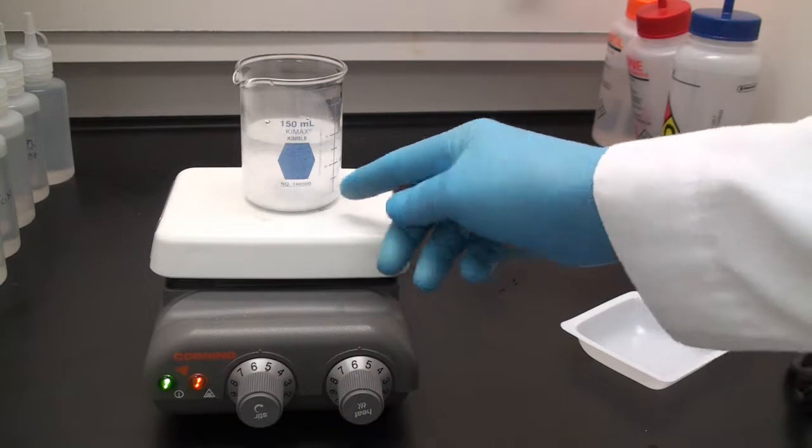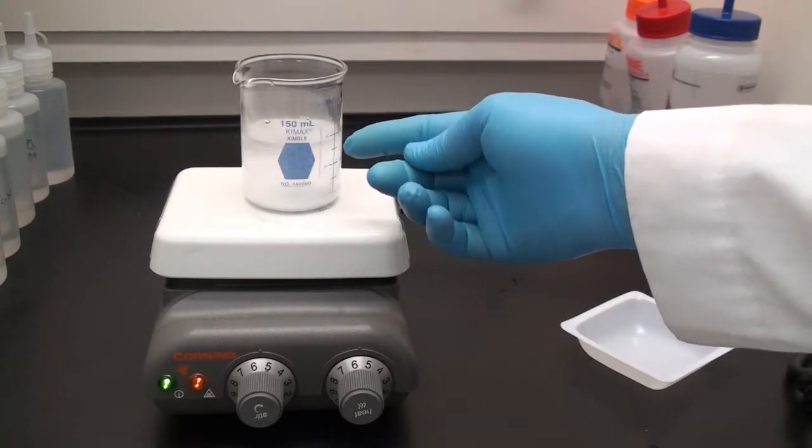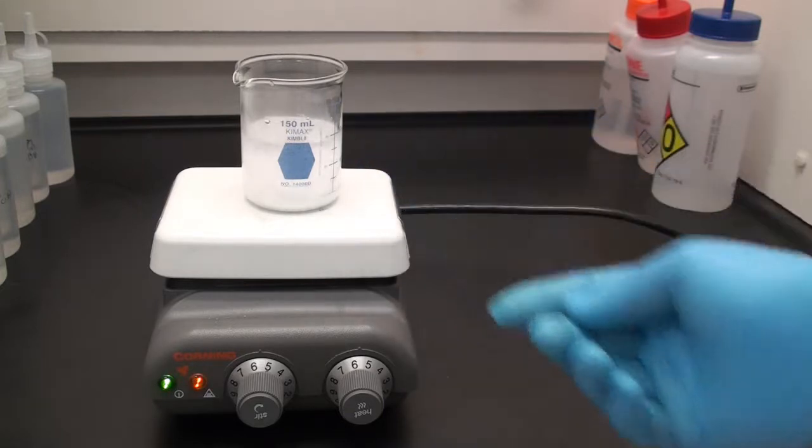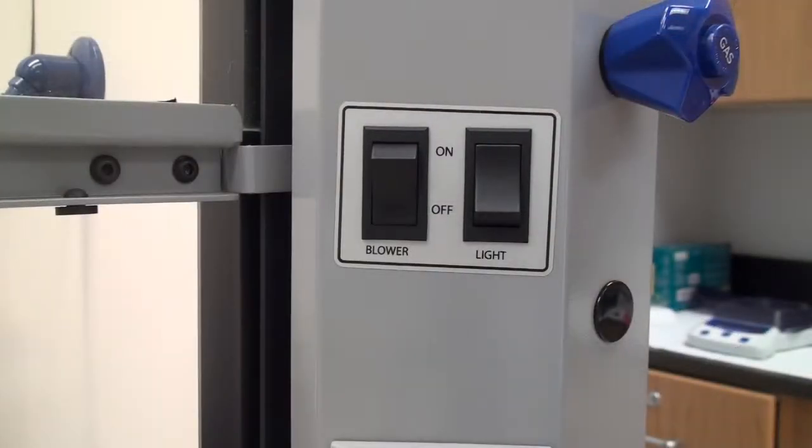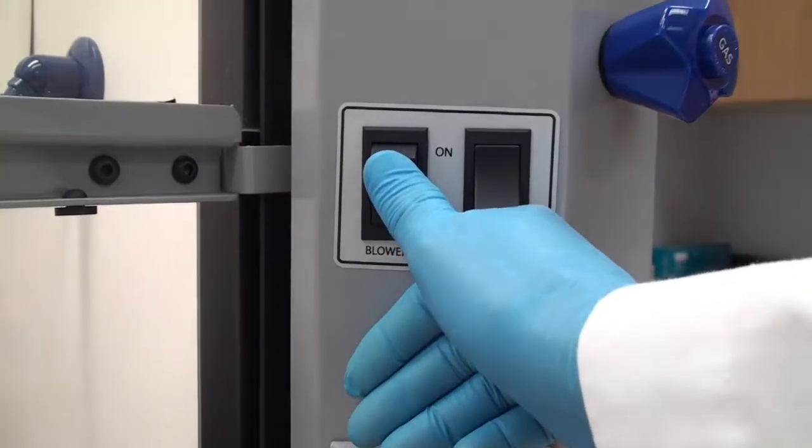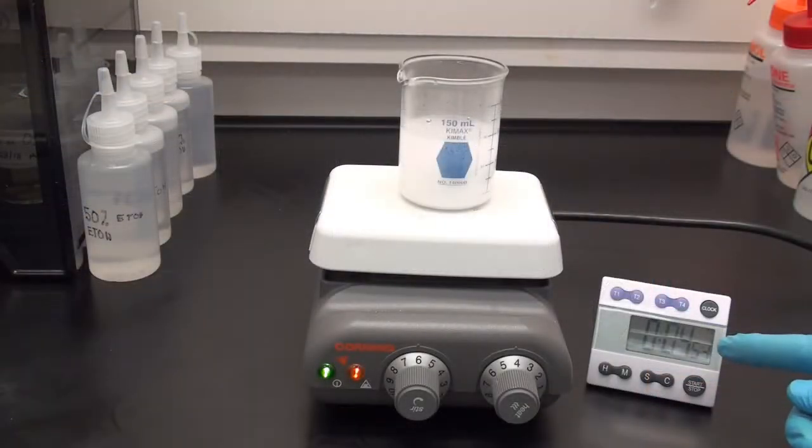Don't over-spin your stir bar, otherwise you can get a vortex that could splash out. Since this is going now, I'm going to go ahead and turn on the fume hood. Because as I heat the paraformaldehyde up and it comes into solution, it is toxic and you don't want to be breathing it.